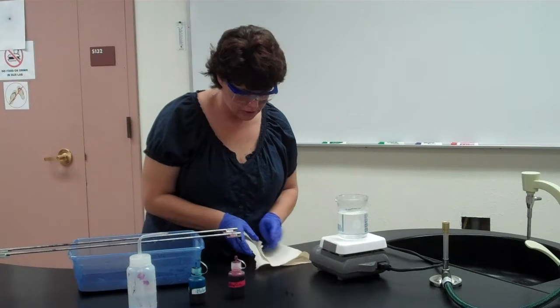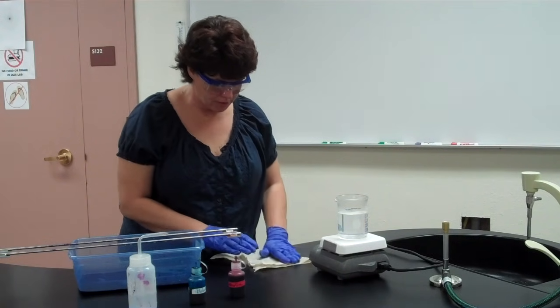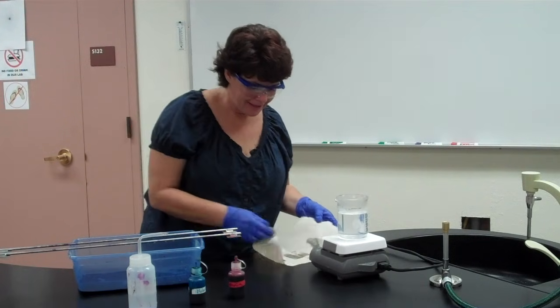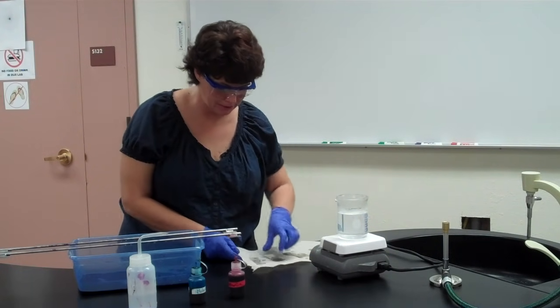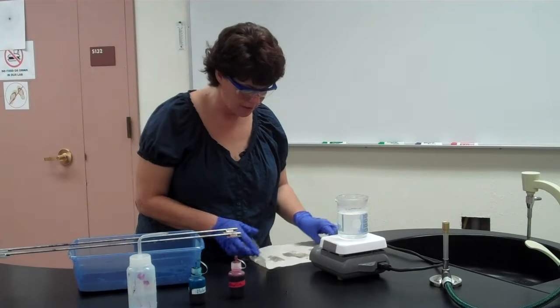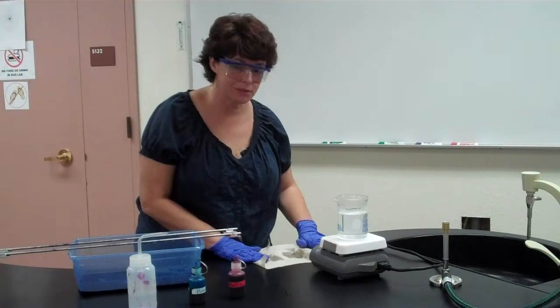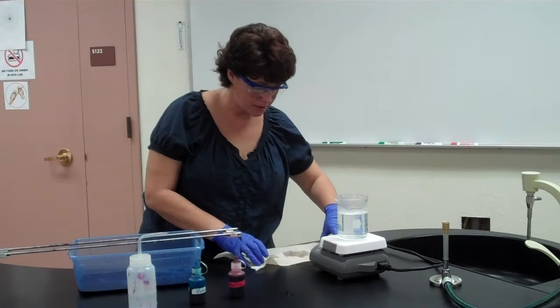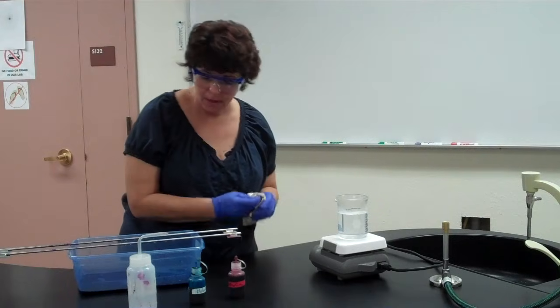A lot of these procedures that you've learned, we're repeating, okay? Smear, fix, then stain. After we stain, we blot dry. Now this is going to be different on the next two stains that we do. But as of yet, everything that we've done pretty much follows the previous procedure, okay? Always make your smear and fix it before you start, okay? So we blotted those dry.